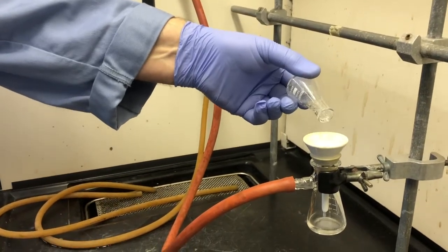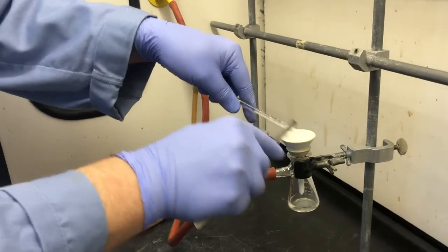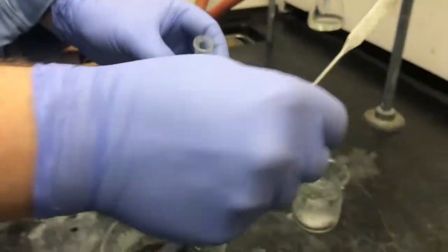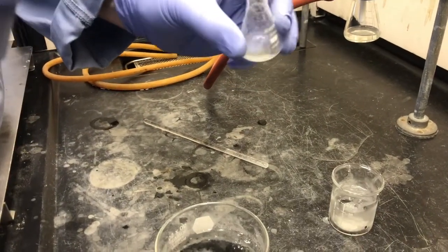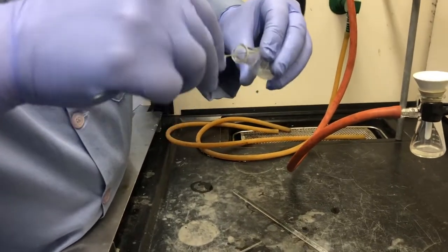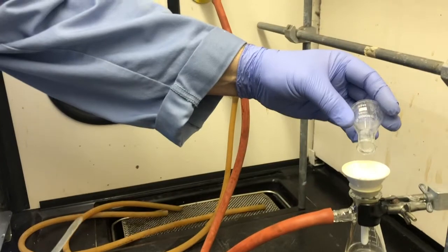It's a slight bit gummy, I think, is why it's doing that. It often is. And scrape every piece of equipment that you've had to come in contact with your solution, get those crystals off. And put a little more cold solvent just to rinse as much out as you possibly can. This is part of the fun of working on a micro scale, is that everything is at such small scale and it actually takes longer to get the crystals out than it would at a larger scale.